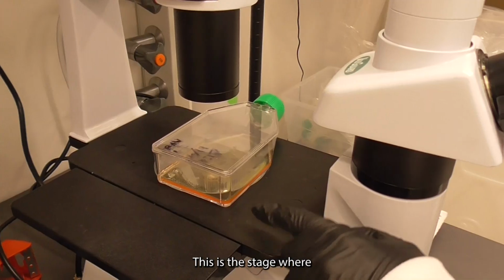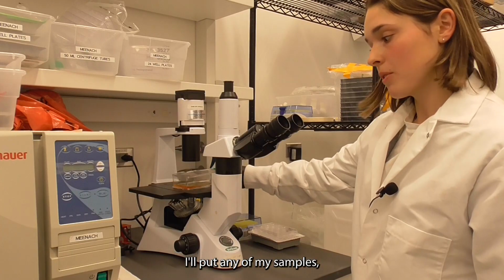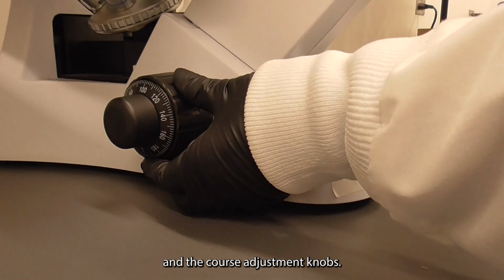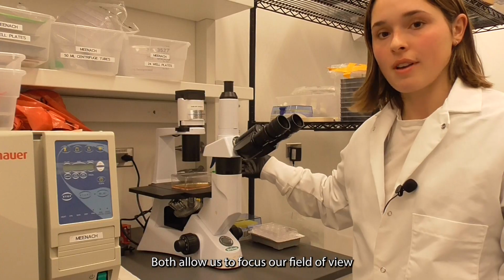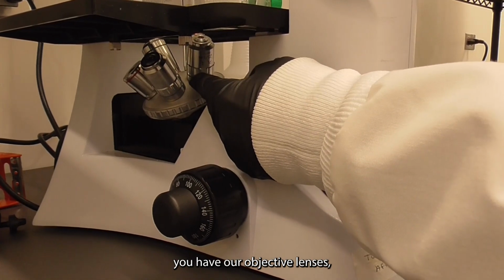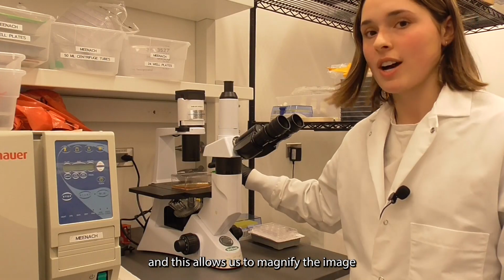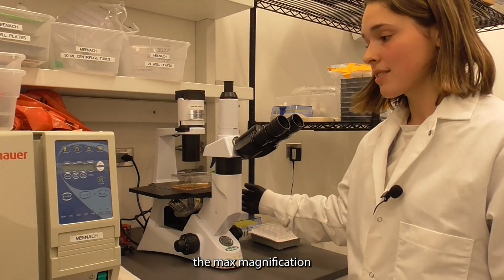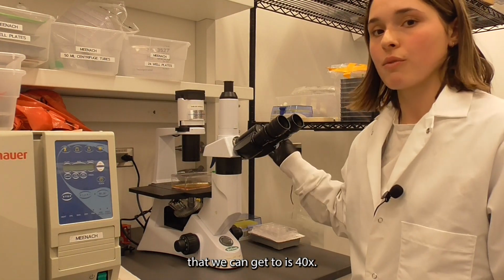This is the stage where I'll put any of my samples, and then we have the fine adjustment knob and the coarse adjustment knobs. Both allow us to focus our field of view. And at the bottom here, you have our objective lenses, and this allows us to magnify the image to a certain extent. On this compound microscope, the max magnification that we can get to is 40x.